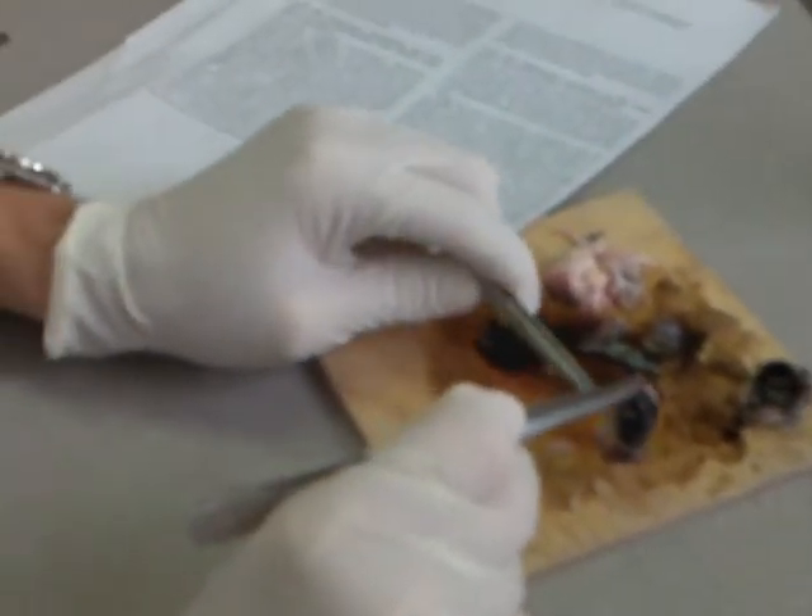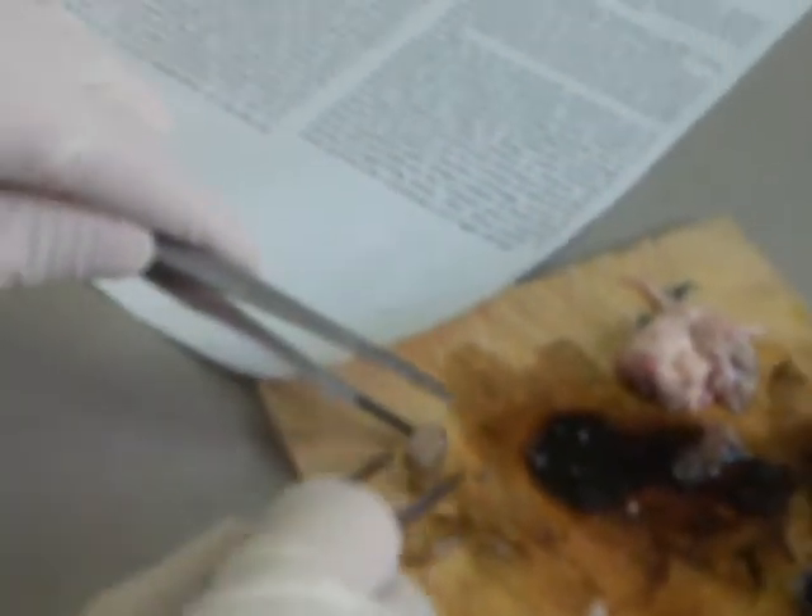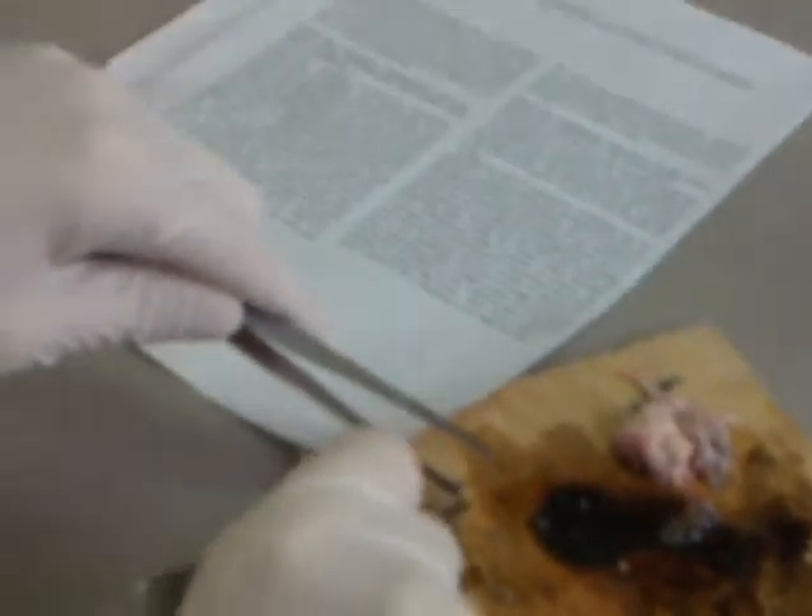As we said, it's like a lupa. If you get rid of the vitreous fluid, the lens really should be attached by muscle all around. Will the lens be fat if it was looking at something close? Because when it was killed, the muscle relaxes. If it's fat, it means that the muscle was contracted. Either it was focused on something and the muscle didn't relax, or it relaxed as soon as it died.